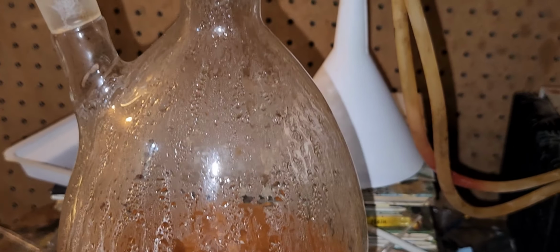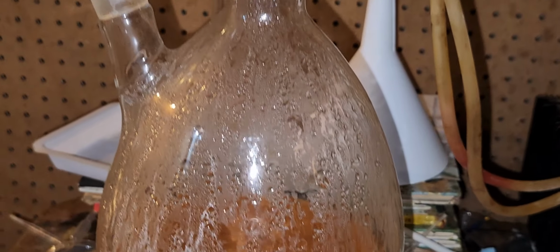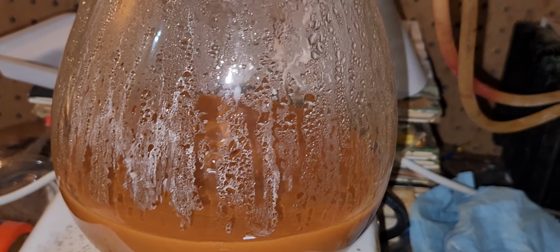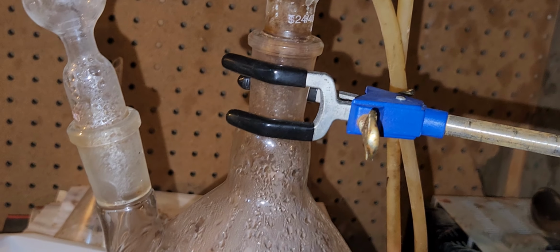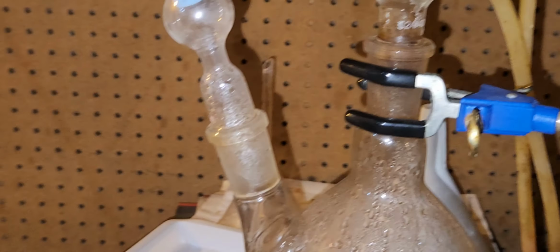So you need to heat it really high, put in the vanadium slowly, then heat it, put it in slowly. That's a really tricky procedure, I think. I have this little tube for air, and I'm allowing air to get in. Maybe that might help with the reaction, but I'm not sure if that will do anything. I'm putting up the stirring. I have the hot plate at around 220 degrees, and the flask around 90. This is a lot better hot plate. I'm disappointed that the other hot plate doesn't work, and that was a really expensive hot plate.